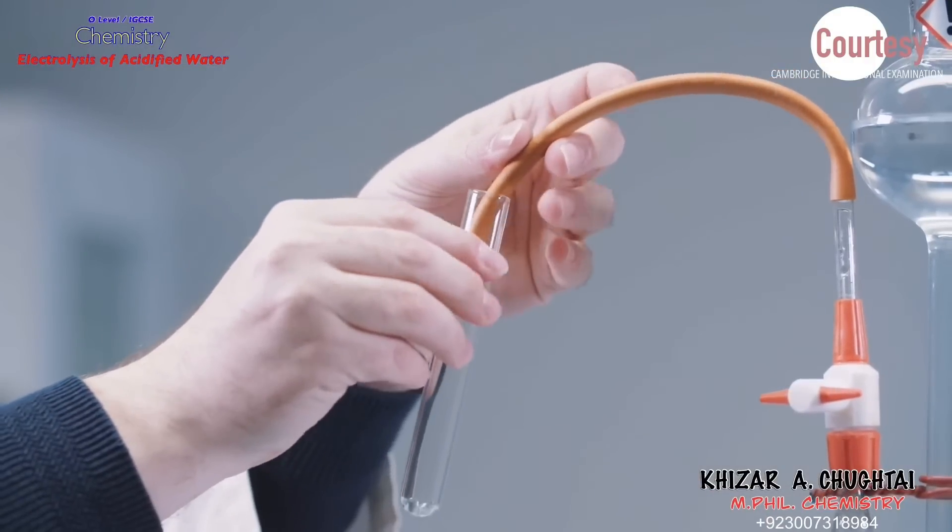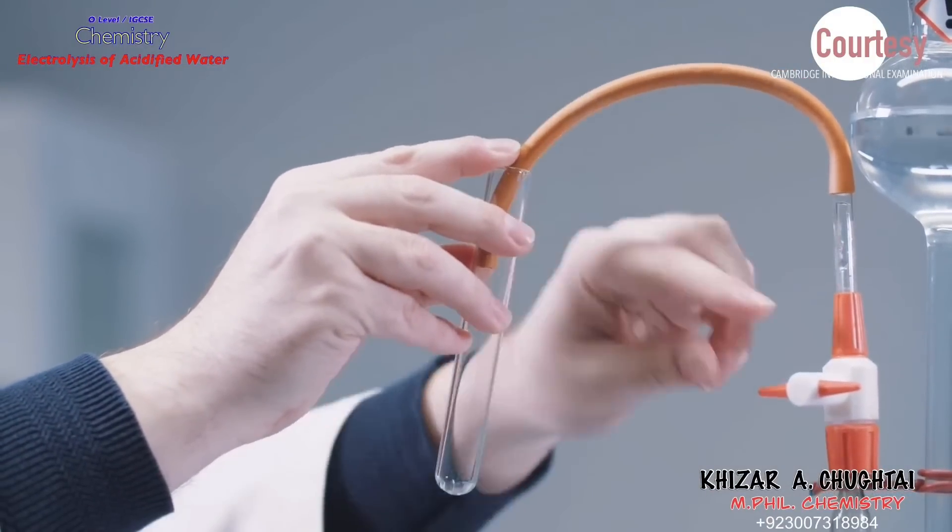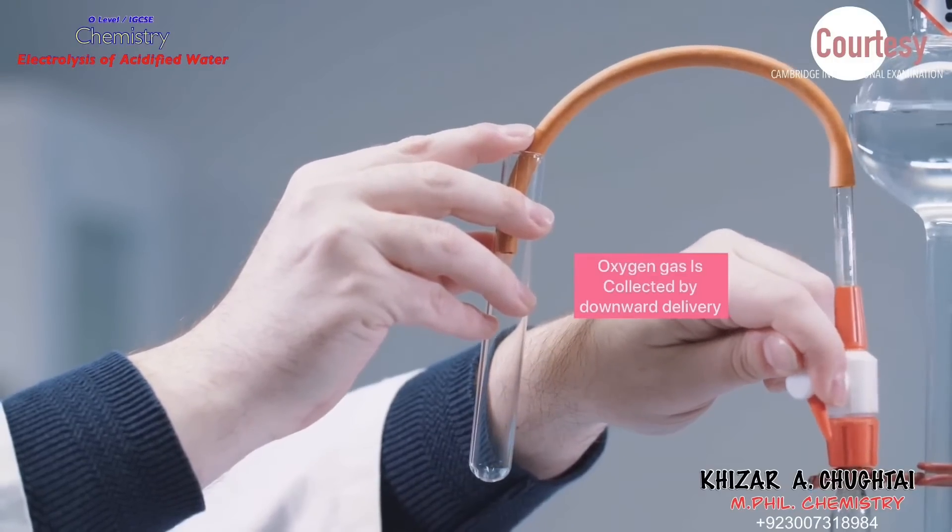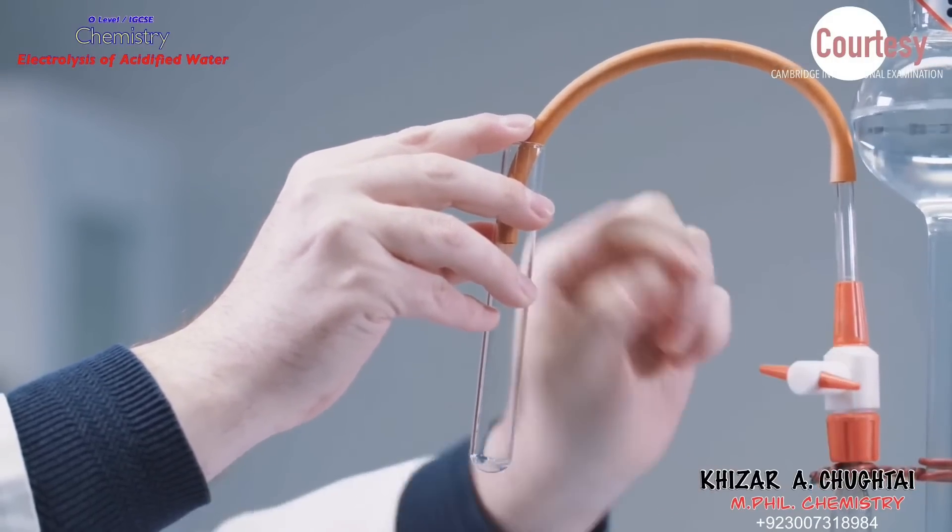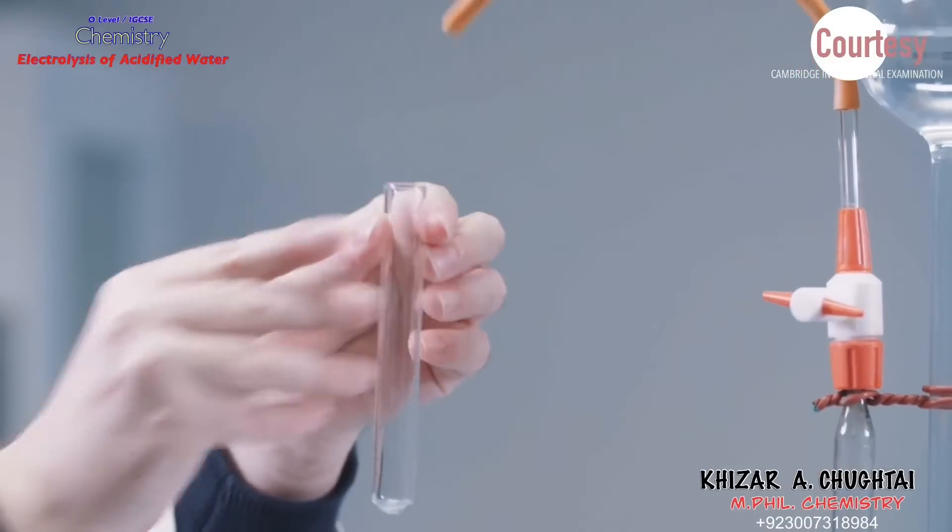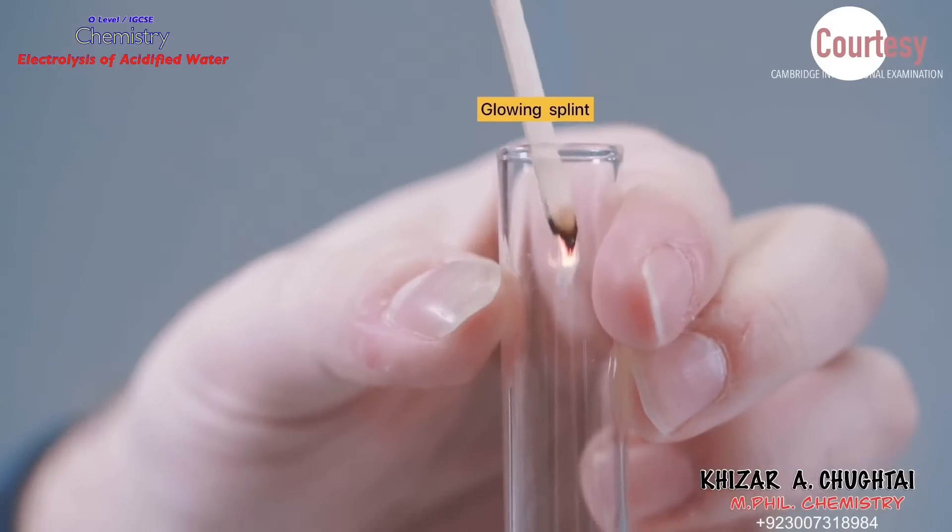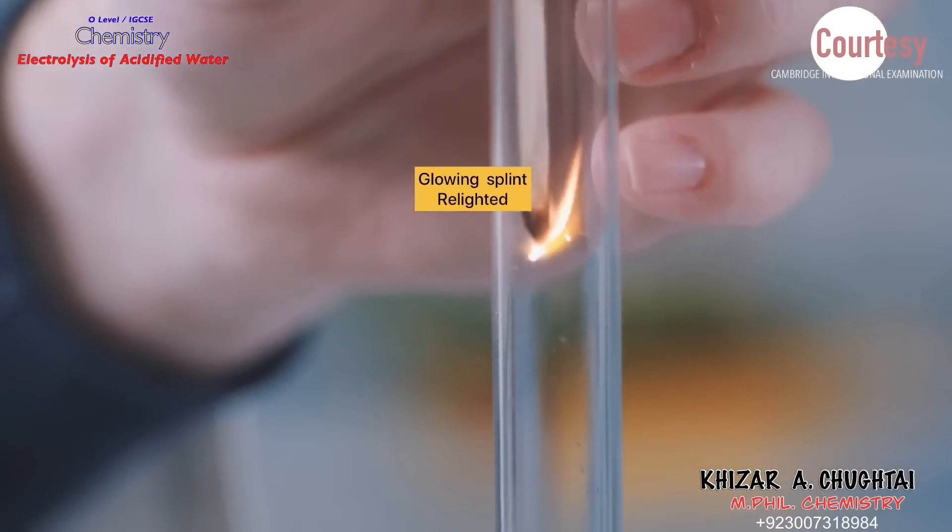Now second tap is opened carefully to capture oxygen gas, as it is a heavy gas so collected by downward delivery. A glowing splint is lowered into the test tube, which reignites, which confirms that this gas is oxygen.